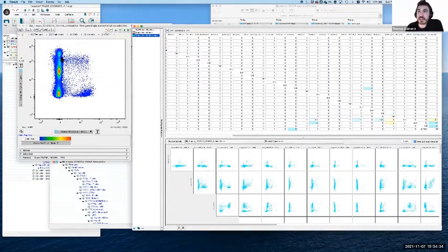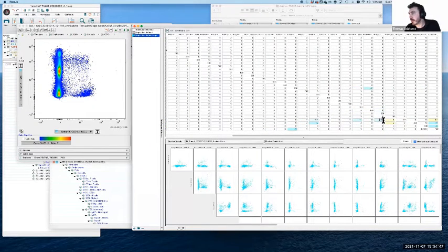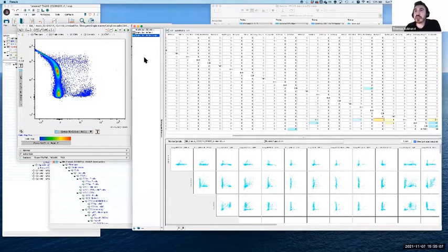Now, it is interesting though, if we apply values here, we actually get the same effect we would see before. So let's say PE-Cy5, we find that, and we look for the corresponding detector, which is, I think, that one. So if we increase this value, PE-Cy7 spilling into PE-Cy5, if we increase this in a positive way, it will push it over, much the same as how normal compensation would work. Maybe that's a bit extreme. Let's just go for something like 2. So we actually do push the data across, because it is a compensation matrix of zeros being applied to integrated data. And in reverse, if we do a negative number, so -2, it will push it to the right.